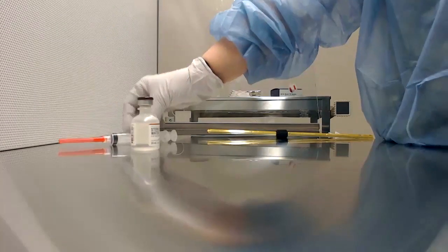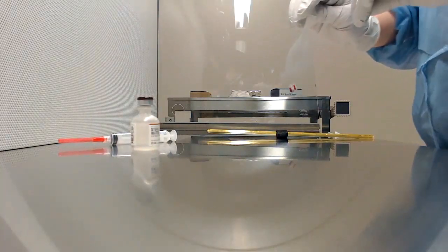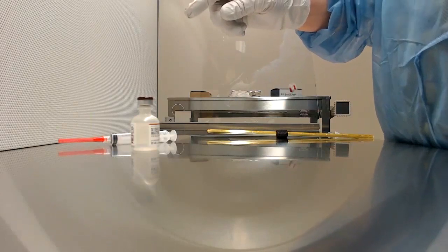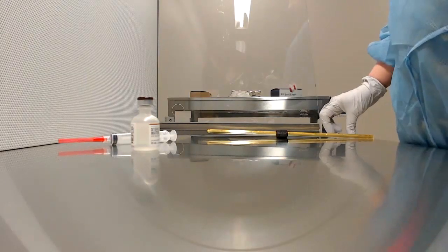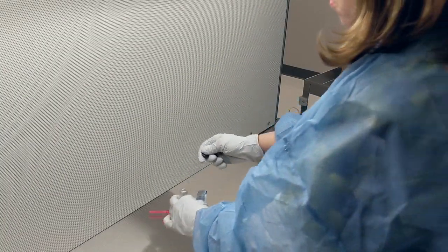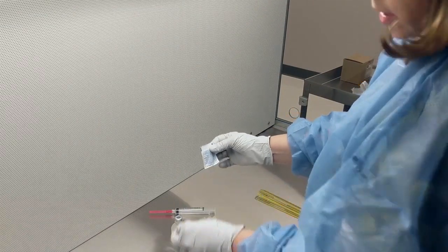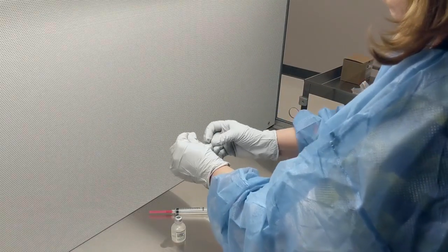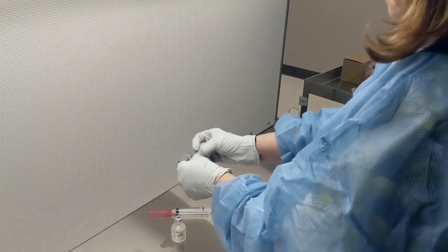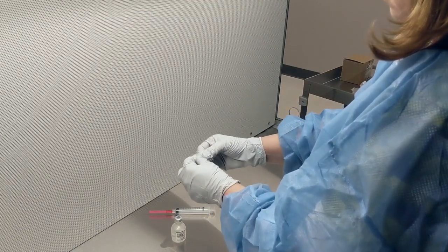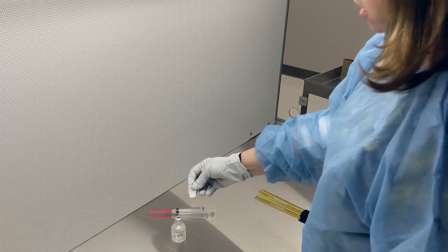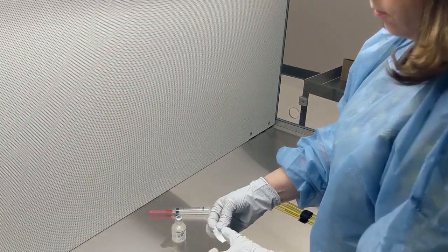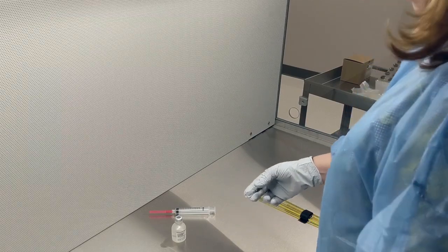Next thing we're going to do is uncap our sterile water and wipe it with an alcohol pad. So we take the cap off, put that back down, and remove the cap to the non-sterile area. I'm going to open up the alcohol wipe, remove the trash to the non-sterile area, and then just wipe it off. Remove the alcohol prep to the non-sterile area. Now we're ready to go.